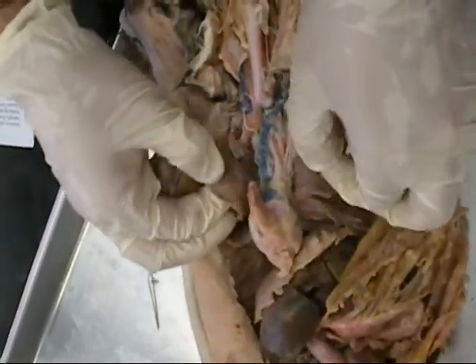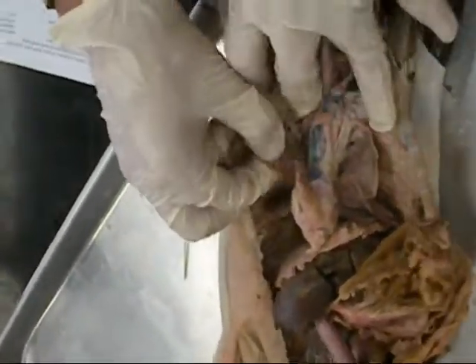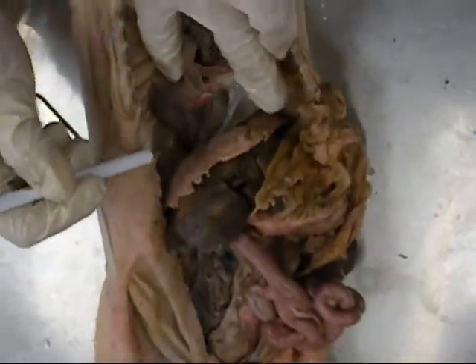When we look at the lobes of the lung, the cat has 4 and 3: 4 on the right, 3 on the left. Anterior, middle, posterior. The fourth lobe from the right side is directly underneath the heart, and that's the mediastinal lobe. It's on top of the diaphragm, underneath the heart. So again, anterior, middle, posterior, mediastinal lobes of the right lung. Anterior, middle, posterior lobes of the left lung. Then the last respiratory structure, the diaphragm.